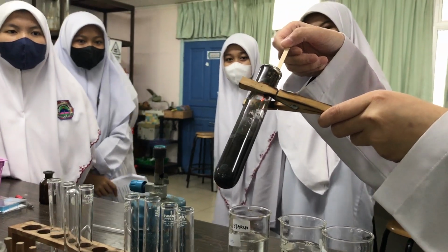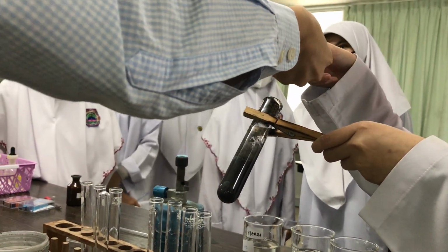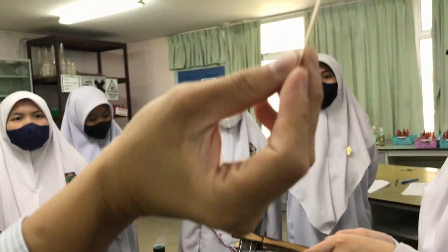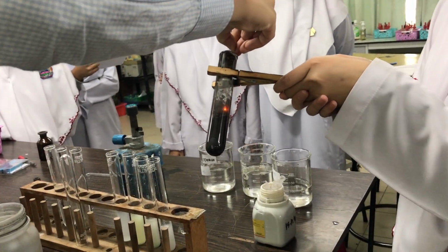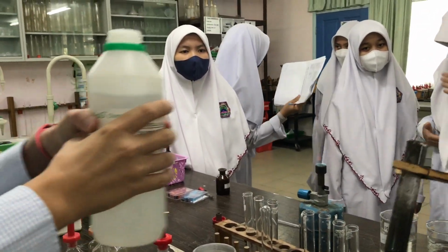Yes. So she put the one which was glowing or burning just now? She put glowing or burning in? Just burning. She put burning. Okay, this is burning or glowing? Glowing. Okay, I think the oxygen is running out, okay? But we can try again. Let me add some more peroxide.